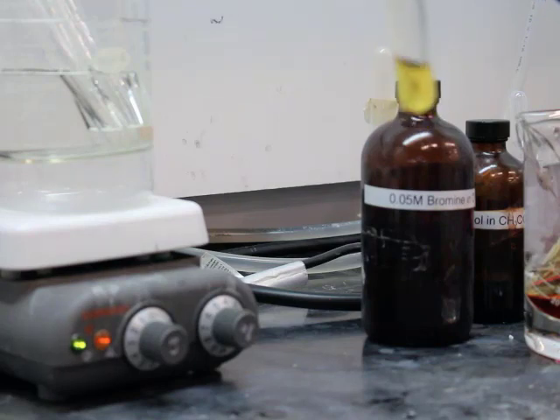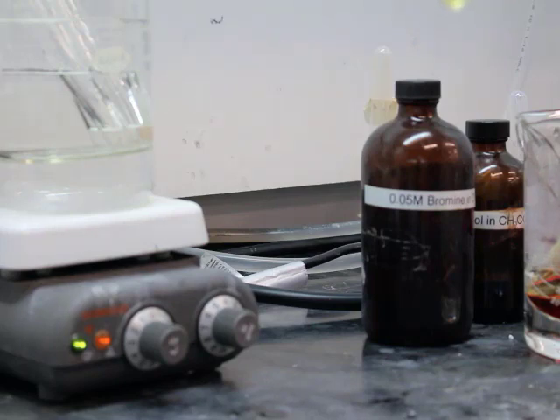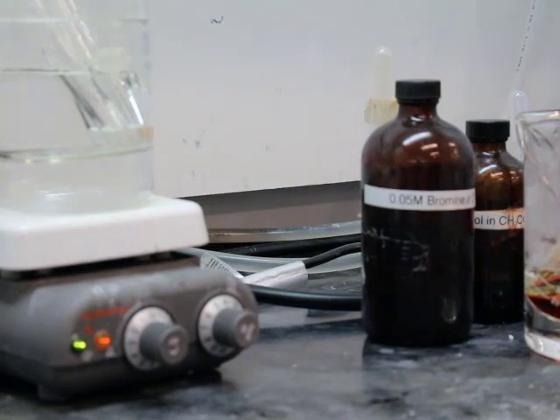So there's that yellow color you're looking for. You can see over here in the corner, you can barely make out that bromine solution, how brown red it is versus that yellow. That's a positive reaction. Remember if bromine is brown, as you use it up, you're going to lose the brown color. So in essence, you have an excess. Look, it's almost clear there. That's how quickly this reaction can happen. That's like a six second deal. Can't really see it. That was too quick. It was about six seconds. All of these time values are summarized at a table at the end for you.